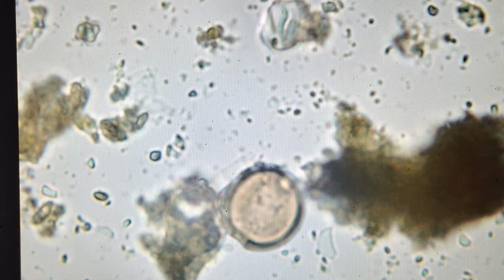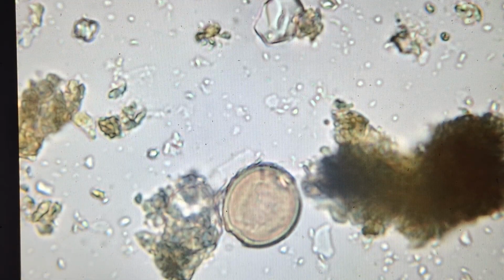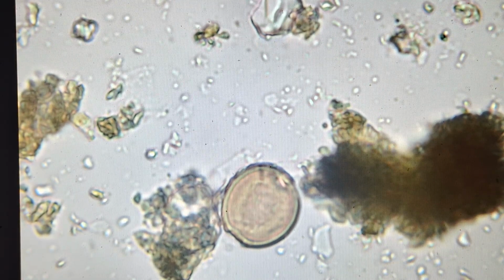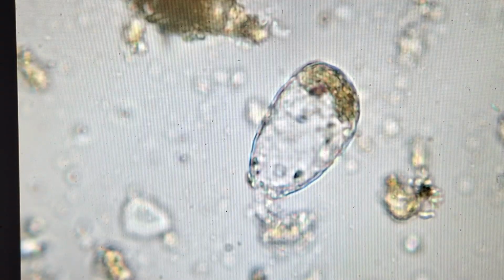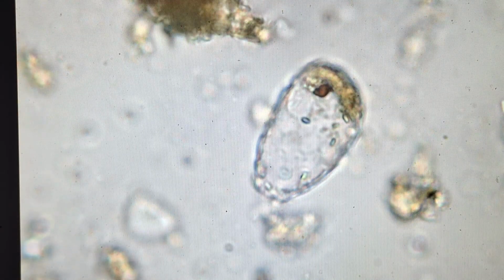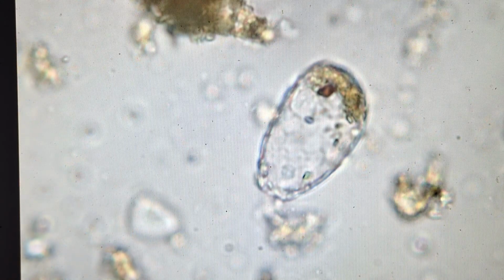You get all around it. We can see all that bacteria and bacteria moving. Lots of bacteria in there. Nice healthy population. And another shelled amoeba. See how similar they look? The mouth on the bottom left.